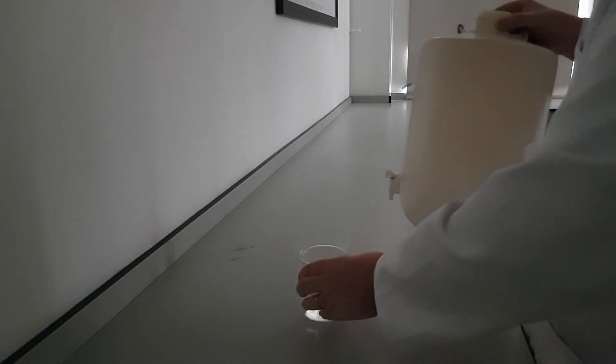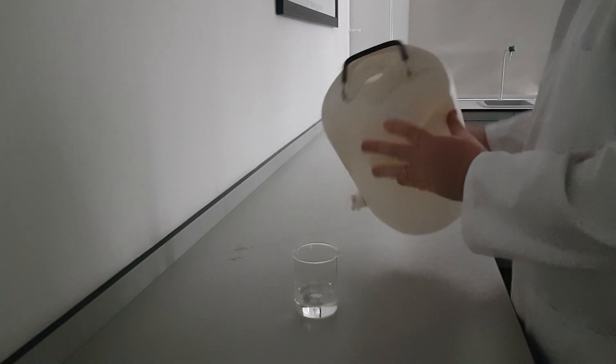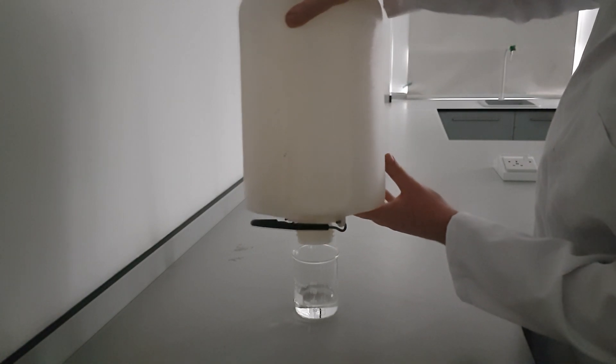Once mixed, empty the excess back into the beaker. We only need the propanol vapor for this demonstration.